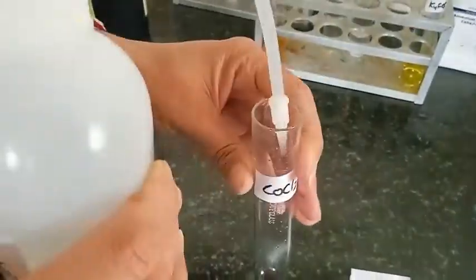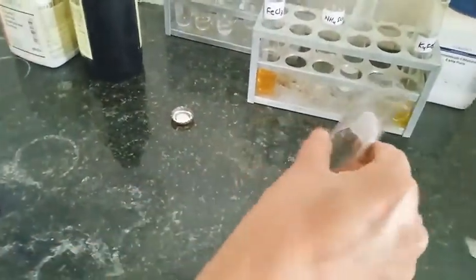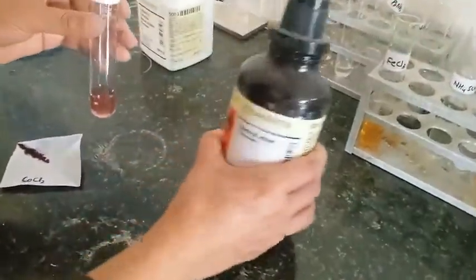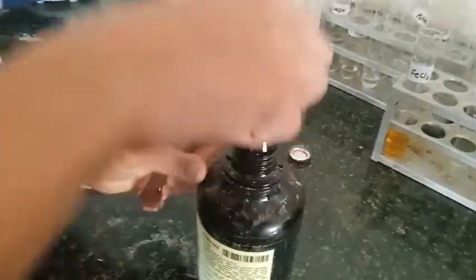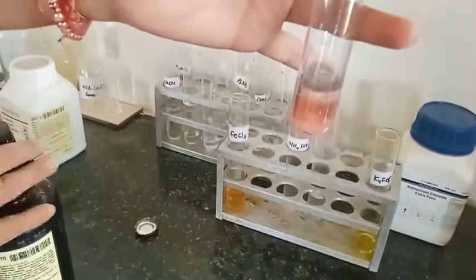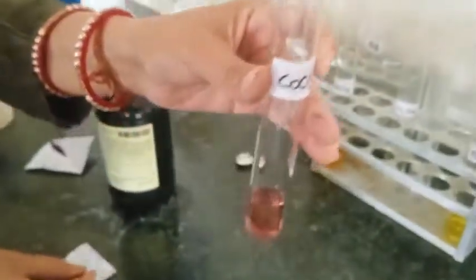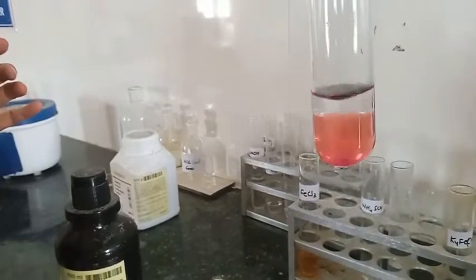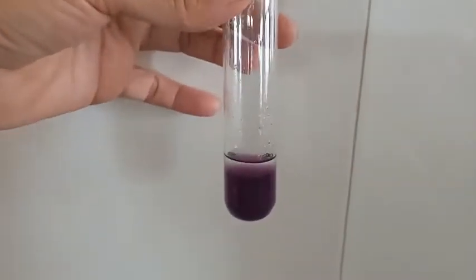Now we are going to test for cobalt ions. You can see how cobalt chloride looks. We prepare the original solution in distilled water and add diethyl ether, which forms an immiscible layer over the water layer. Adding ammonium thiocyanate, you can see the purple colour of cobalt thiocyanate at the bottom. On shaking, it gives a purple colour and its reflection appears in the ether layer, confirming the cobalt ion.